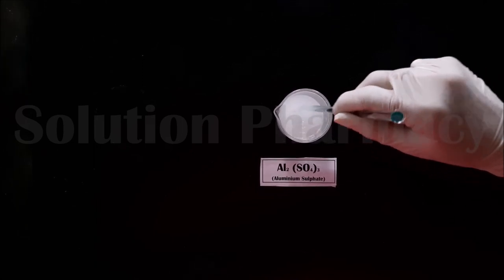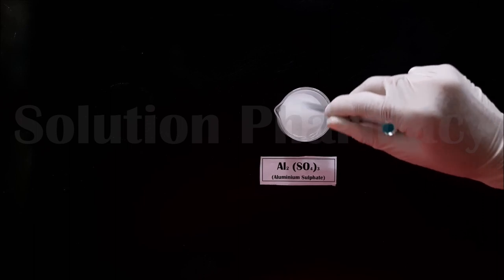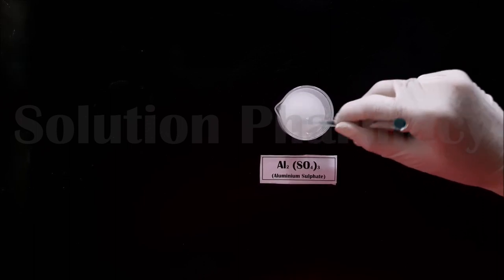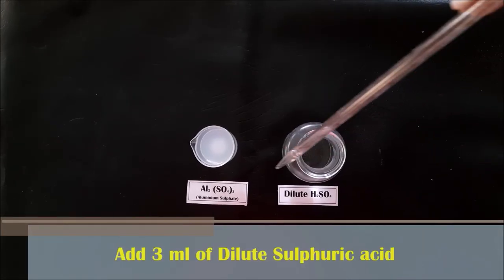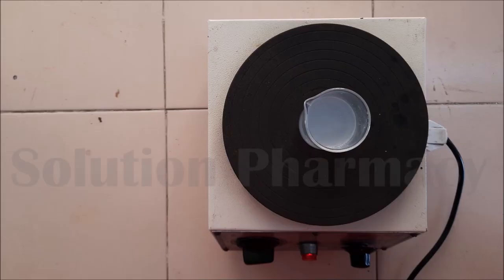Dissolve the aluminum sulfate in water by stirring with a glass rod. You can also use warm distilled water to more easily dissolve the aluminum sulfate. After dissolving it completely, add 3 ml of dilute H₂SO₄, or you can warm the beaker to assist complete dissolution.